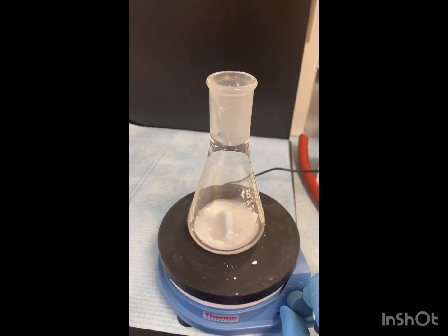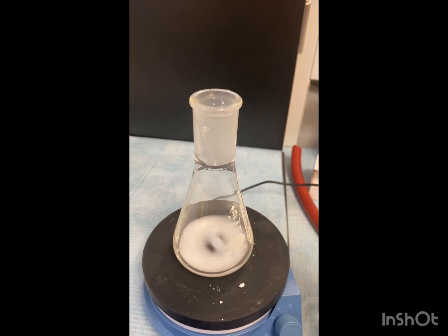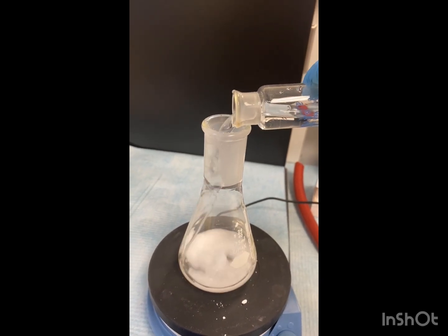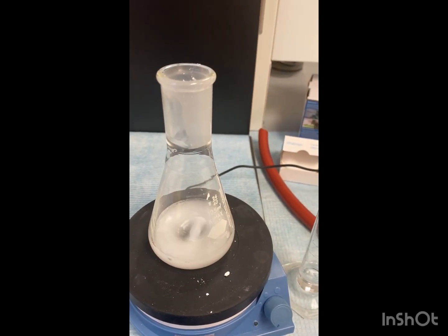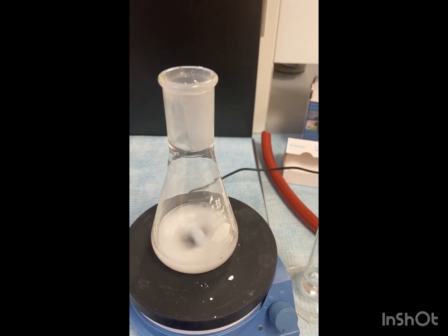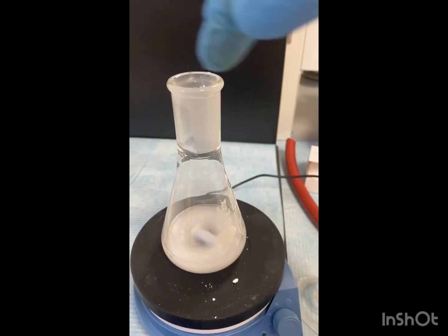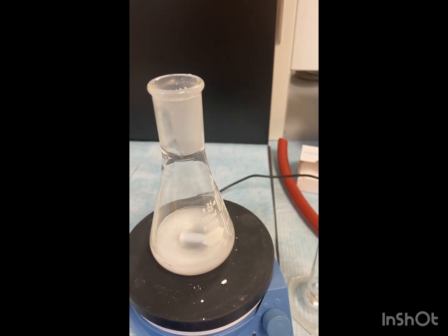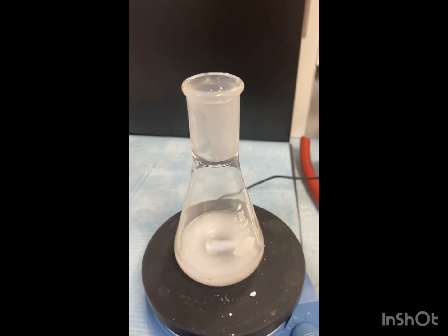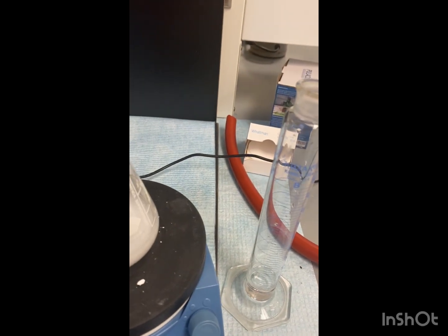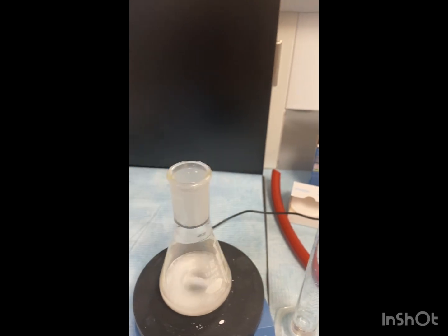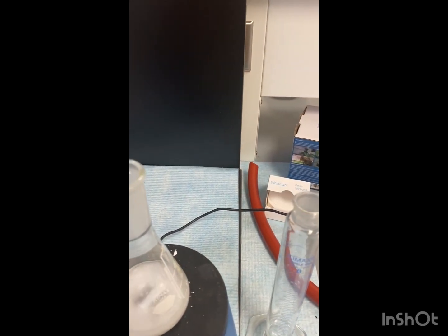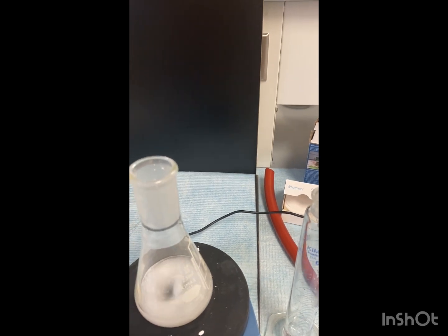So we're doing this to hydrolyze the salt. Alright, I'm going to spin it. Add a little bit. And we're going to let this stir for about 15 minutes. I'm going to use a glass pipette to just occasionally rinse the sides of the flask. You'll want to use a glass pipette. Glass pipette. Put a little bulb on it. Again, we're going to rinse the flask. And we're going to do this for about 15 minutes. After this, we're going to collect the solid again by vacuum filtration.